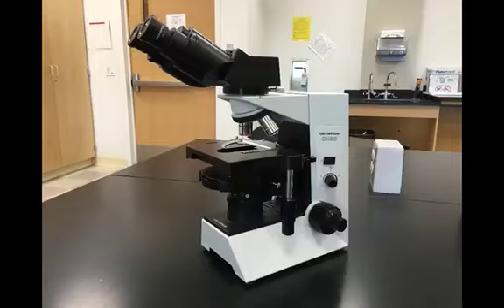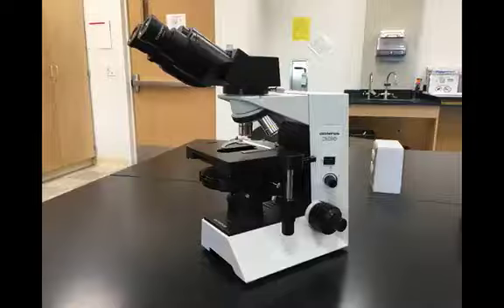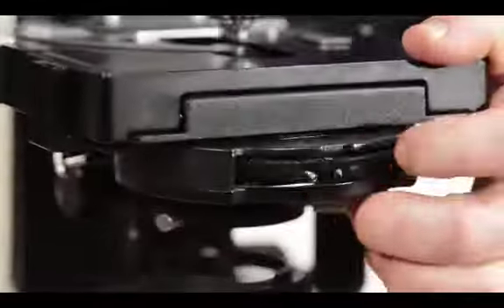In this short tutorial, I'm going to show you how to use the phase contrast compound microscope that we use in Biz 2C labs. We use microscopes regularly in Biz 2C, but most intensively in labs 3, 6, and 7. In the first part of the video, I will break down the microscope and describe the function of each part.